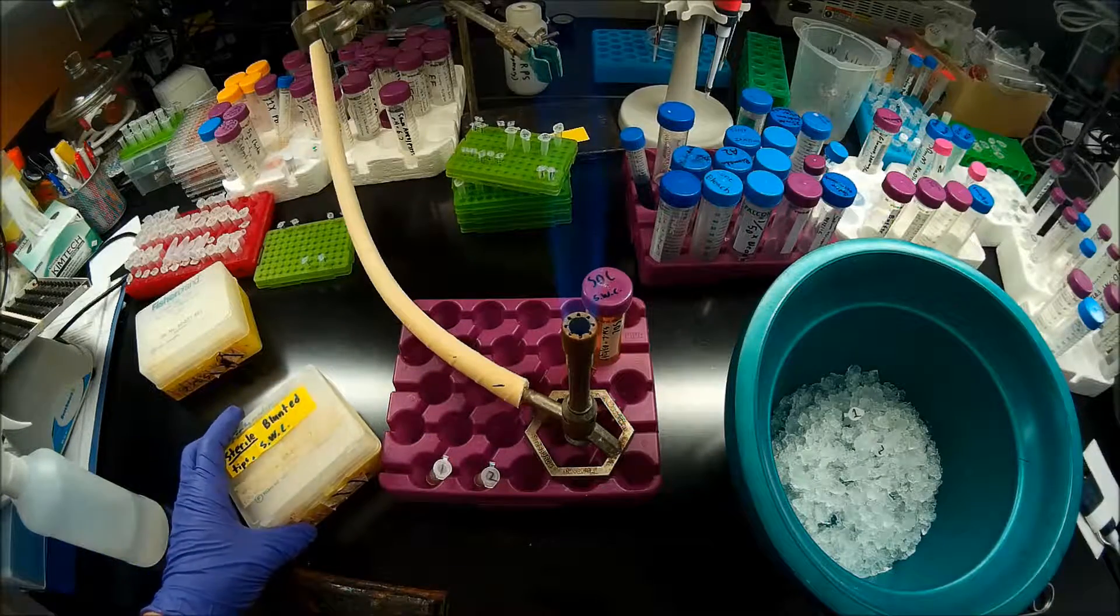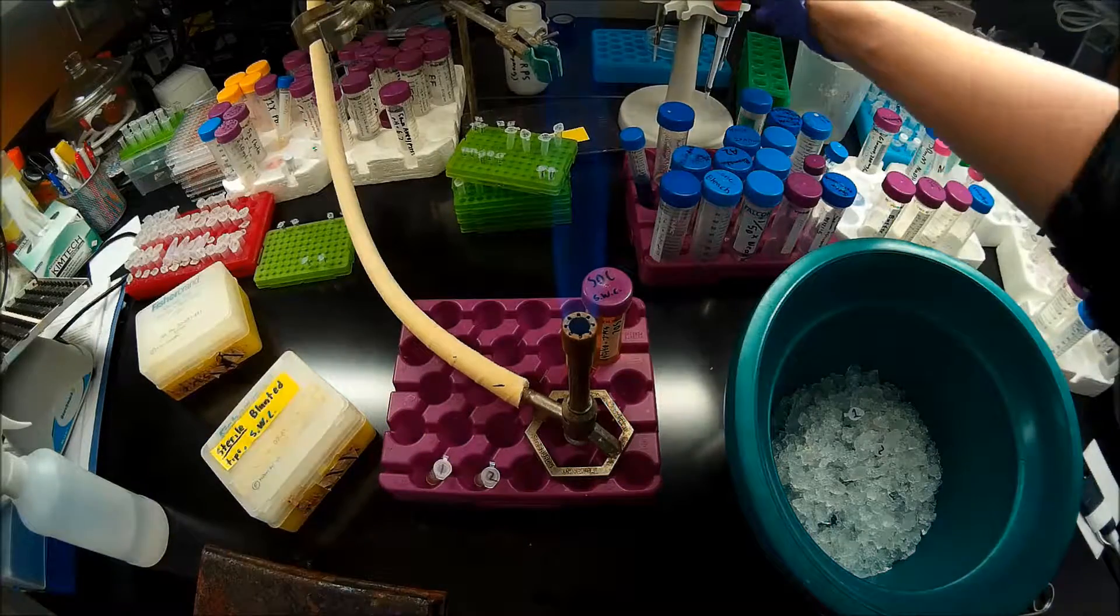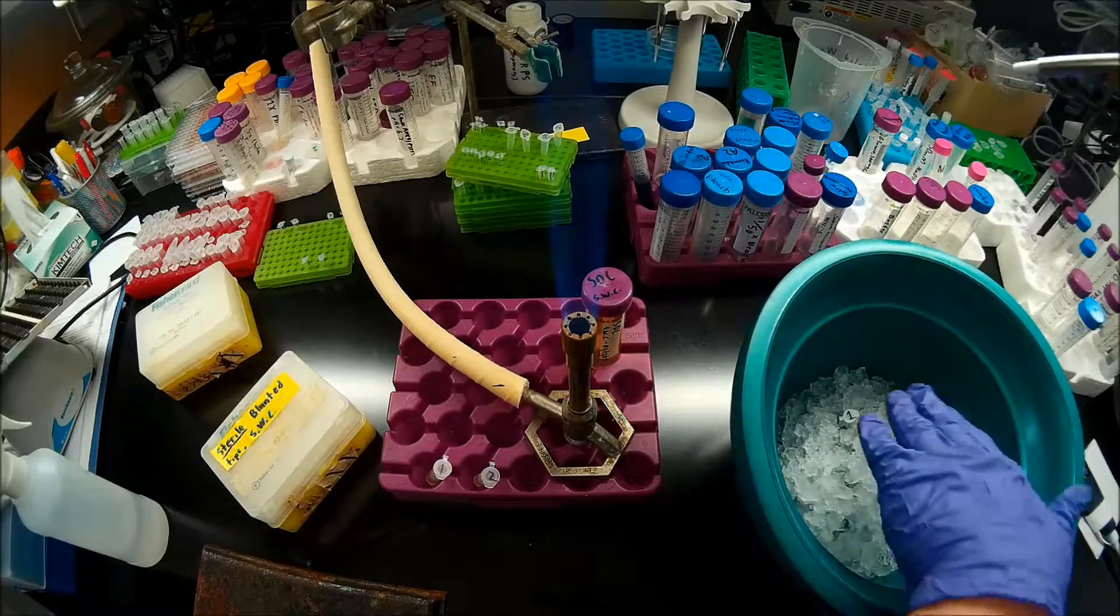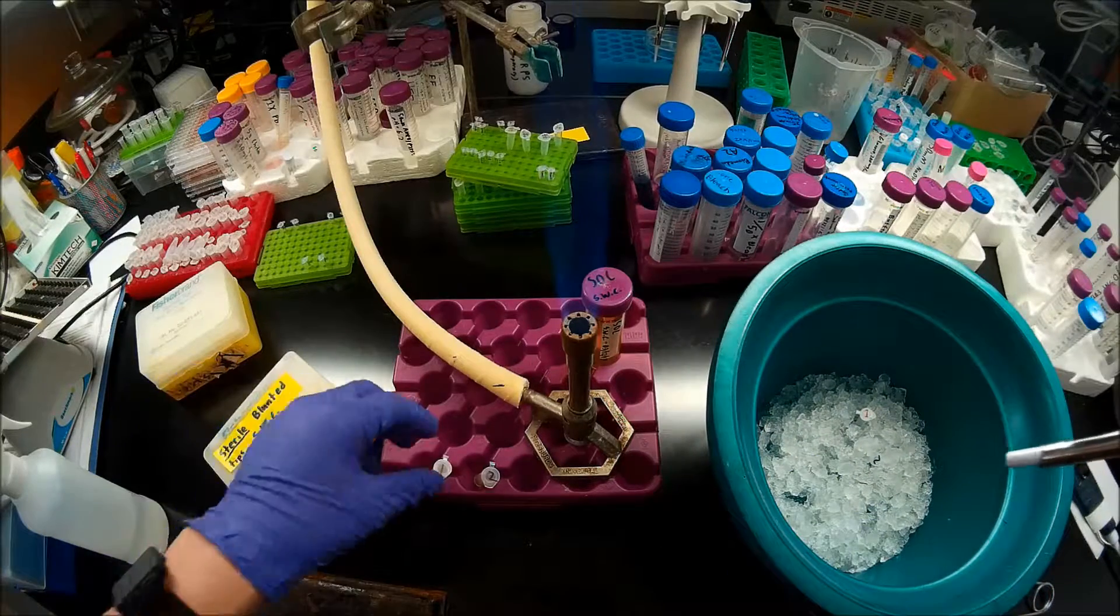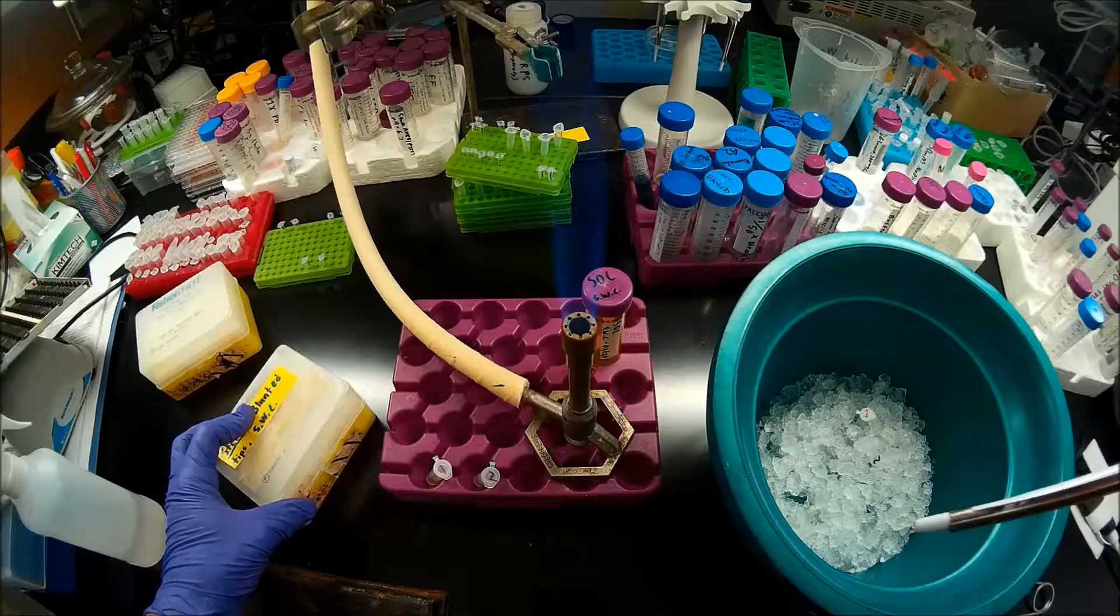So now using blunted pipette tips, I'm going to transfer the entire contents of these competent cells, these transformed competent cells, into these 2 mil tubes containing SOC for a recovery step.